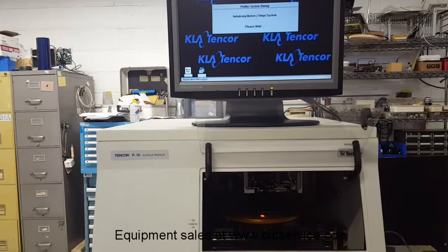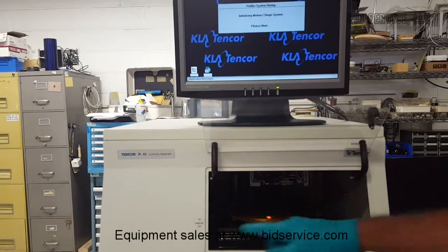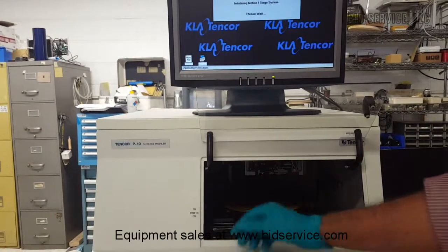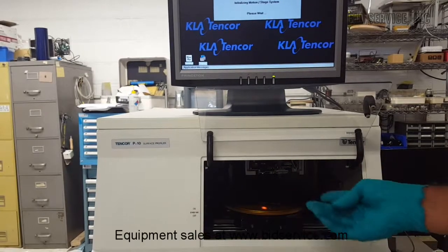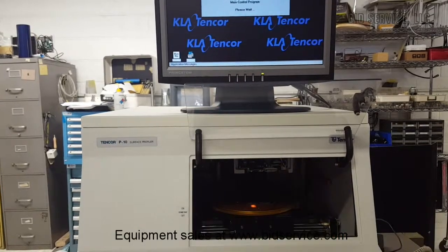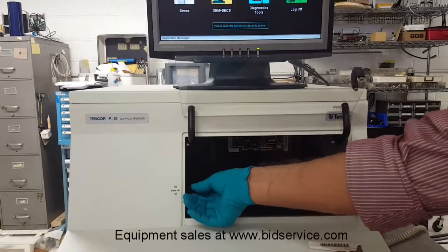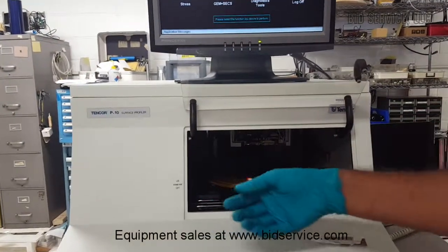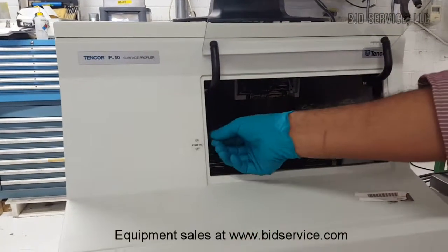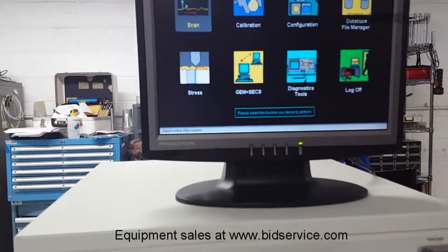In case a 6-inch or 8-inch wafer is to be loaded, there's a stage vacuum provision. Right now I'm not using a wafer, so I have disabled it. I'm going to demonstrate. It's a manual vacuum operation on this machine. So this toggle switch here is a pneumatic switch. You load the wafer and then you enable this vacuum switch so that the wafer is held on the chuck. So that is a quick initialization of the stage.